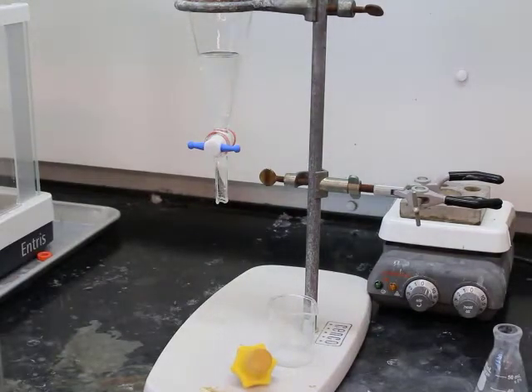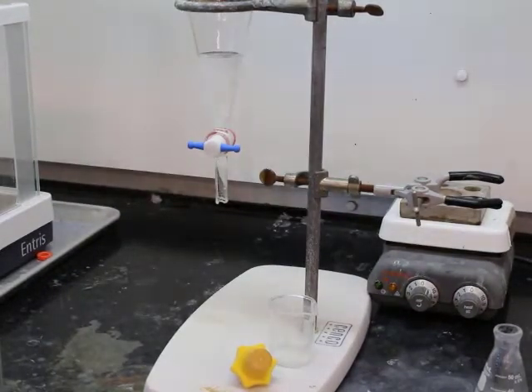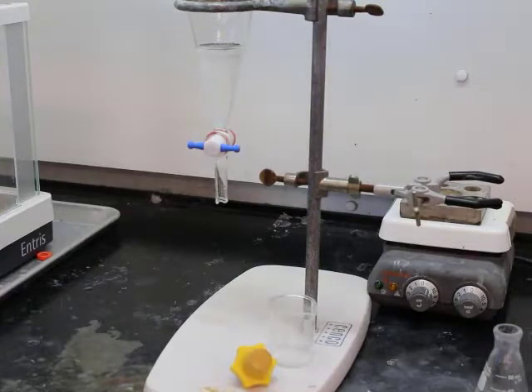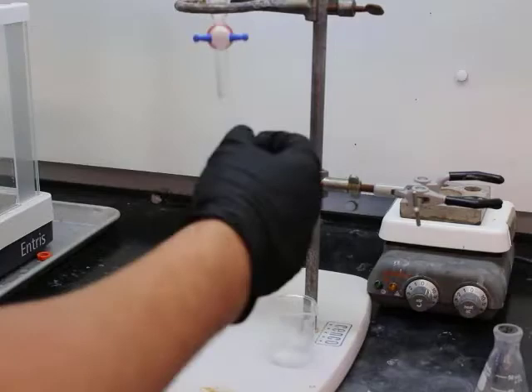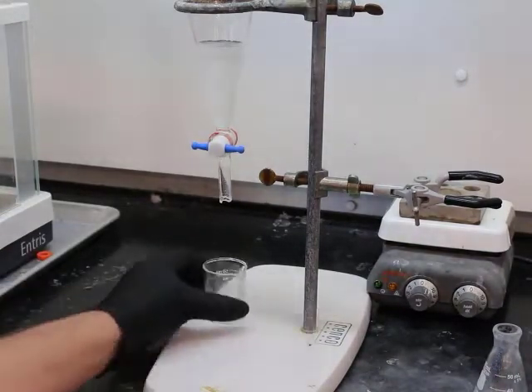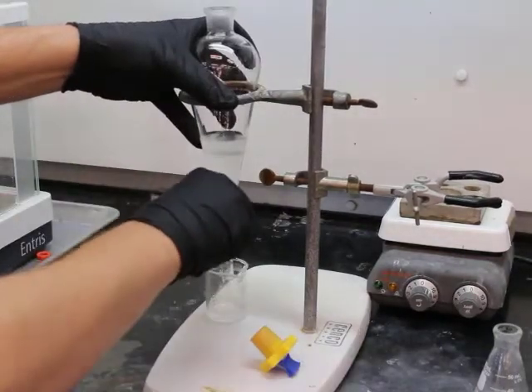Alright, now to the organic layer. Per the instructions, we are going to now add 5% HCl. Alright, and this will react with any base that may be present in our organic layer, and if it does react, it'll turn that base into an ionic compound, making it much more soluble in that aqueous layer, in the HCl layer, which is aqueous. Alright, mixed it, did a super mix.